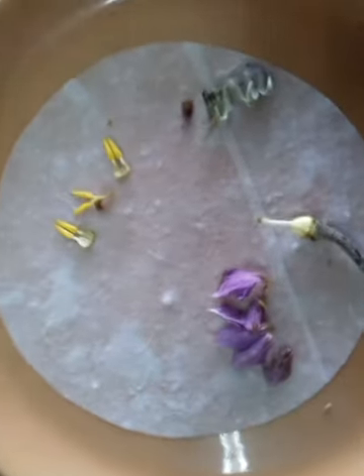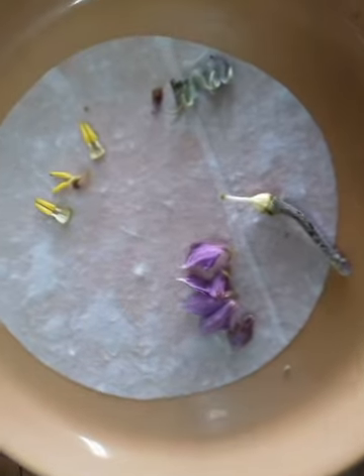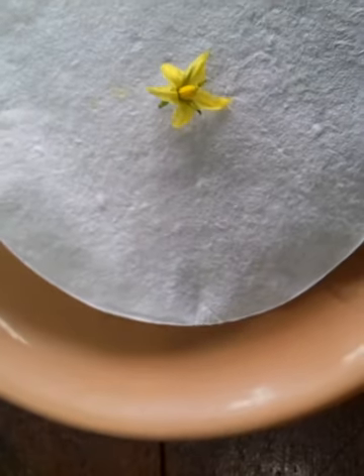And when you draw the flower, whatever flower is given, you have to draw accurately like this. Suppose you are given brinjal, you have to draw like this. If you have to dissect the flower of tomato, you have to dissect it like this.